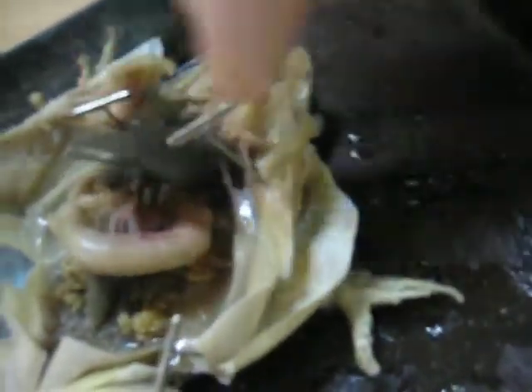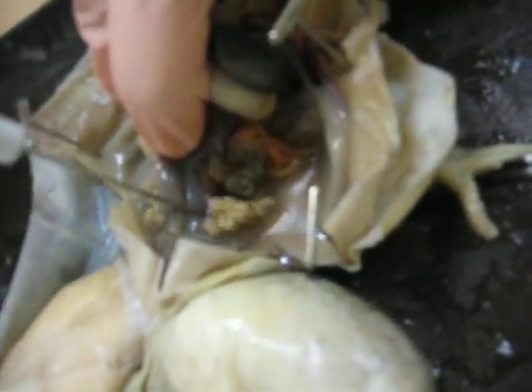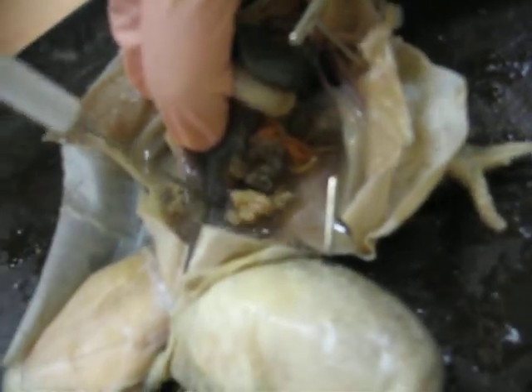And then we have kidneys. Kidney — down here. One kidney, and the other kidney is down here. Two kidneys. And urinary bladder — the sac right here.